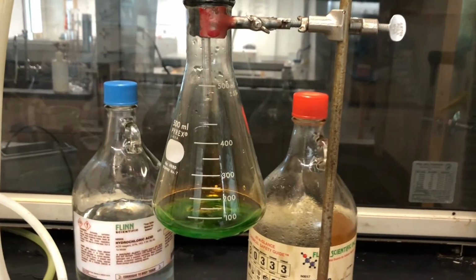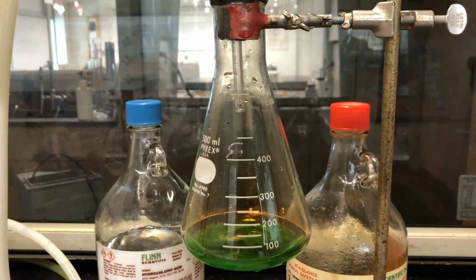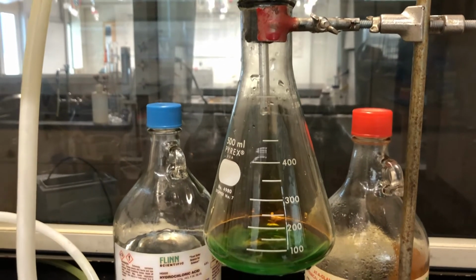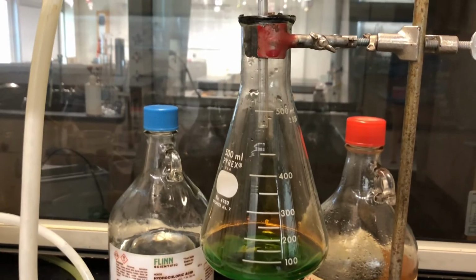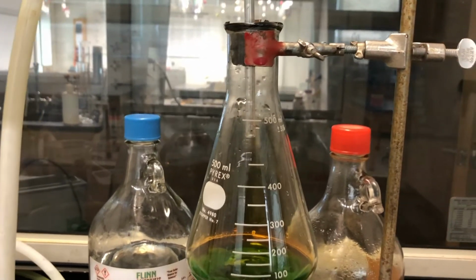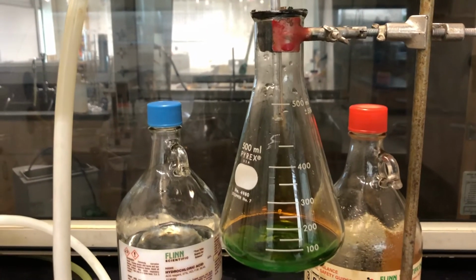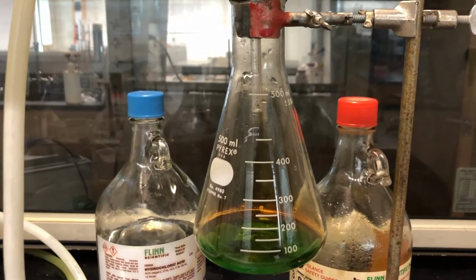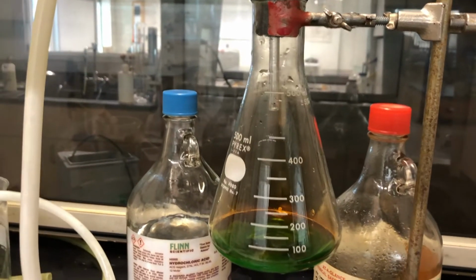So let's go back to the flask of interest, and you can start to see another reason that I'm doing this in the fume hood. You might also remember from chemistry last year, if you can ever see a gas, that's a bad sign. I think every gas that is visible is also poisonous. So we want to make sure to do this in the fume hood, really for my safety. You don't have to worry about it because you're not here. But I really don't want to breathe in the NO2, the nitrogen dioxide gas, any more than you would if you were actually here with me, which I wish you were.